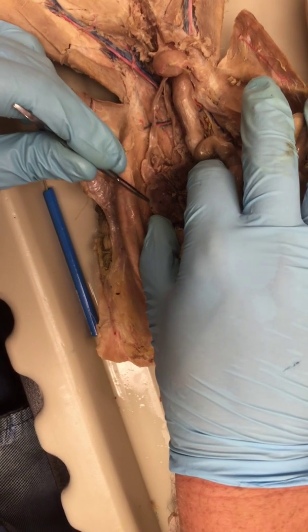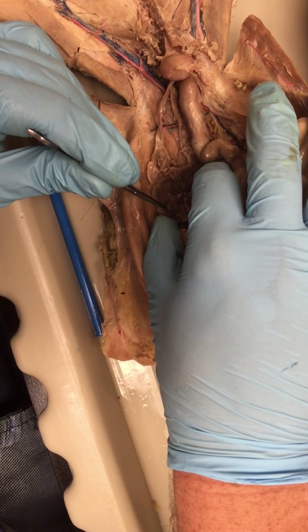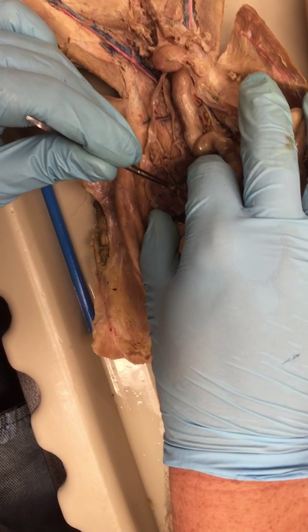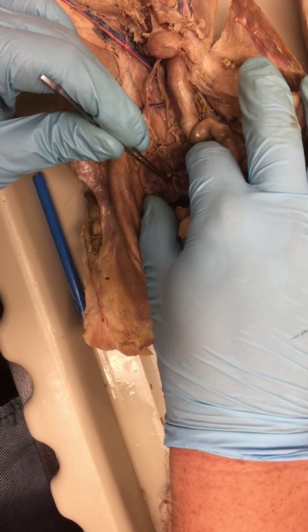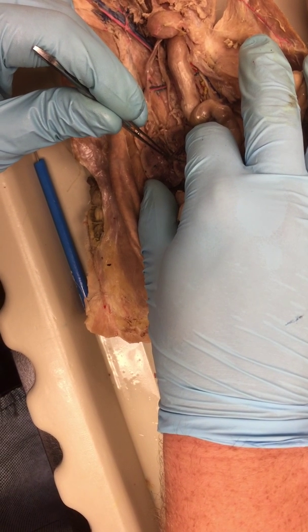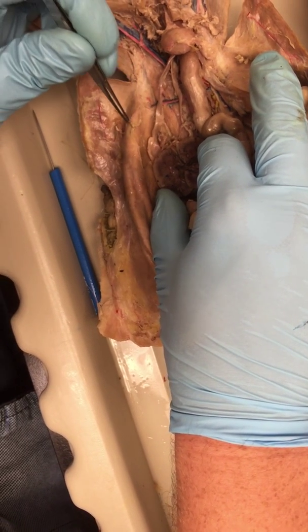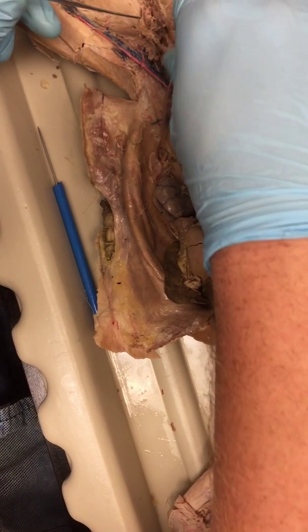On the inside of the kidney, I chose the wrong kidney for this. You're going to find the renal cortex, the renal medulla, and the renal papilla right here. Underneath the papilla, you're going to find the portion at the center that everything connects into. That's going to be called the renal pelvis. All right, so there's the ureter, comes down here and connects to the bladder.